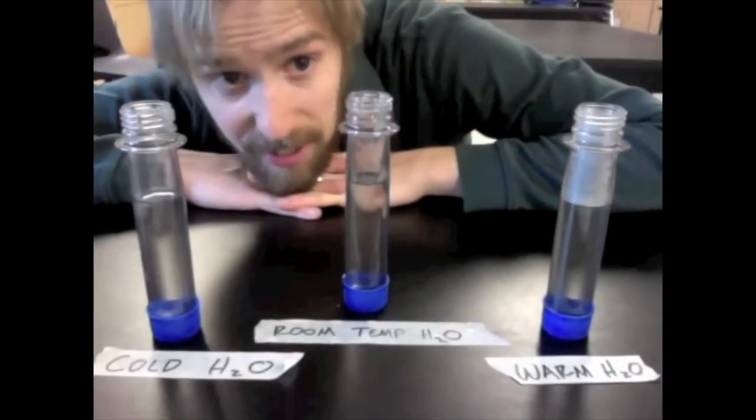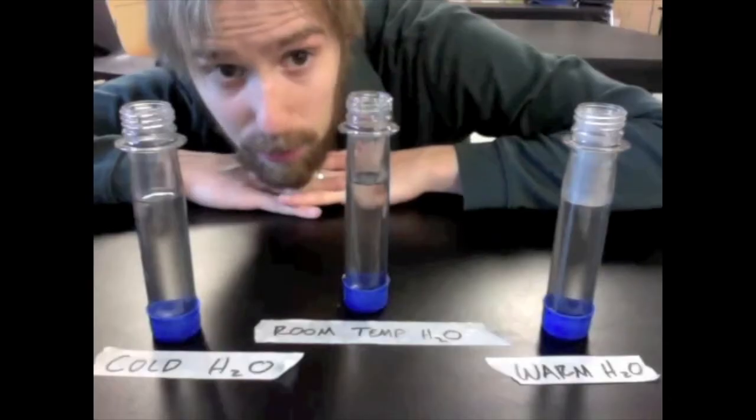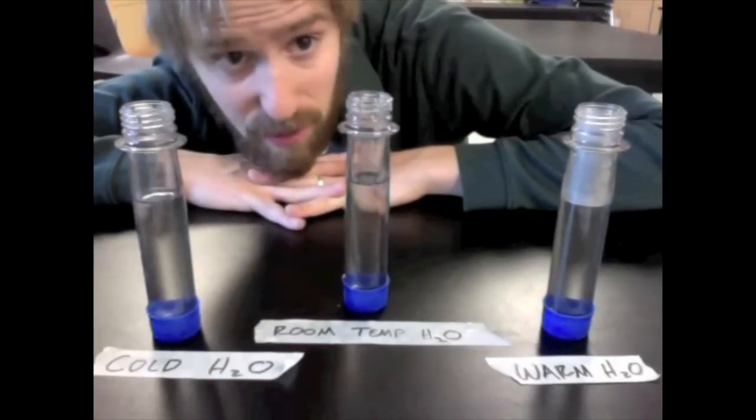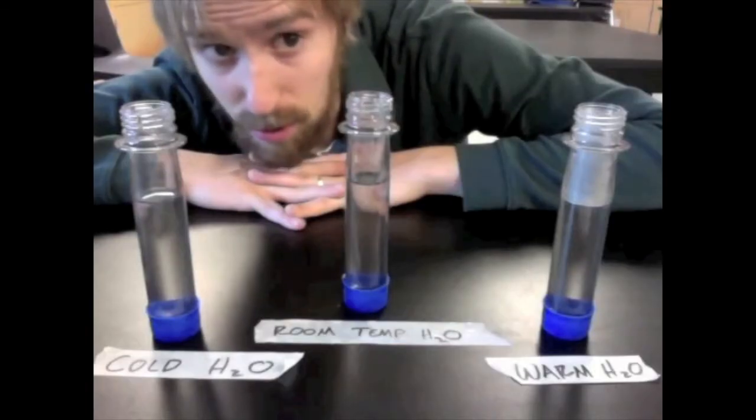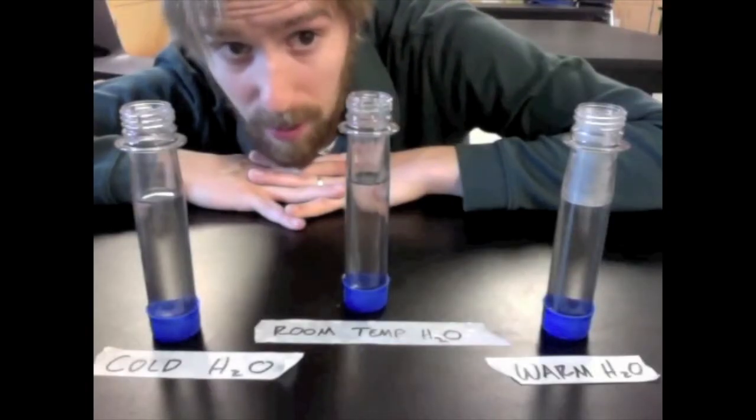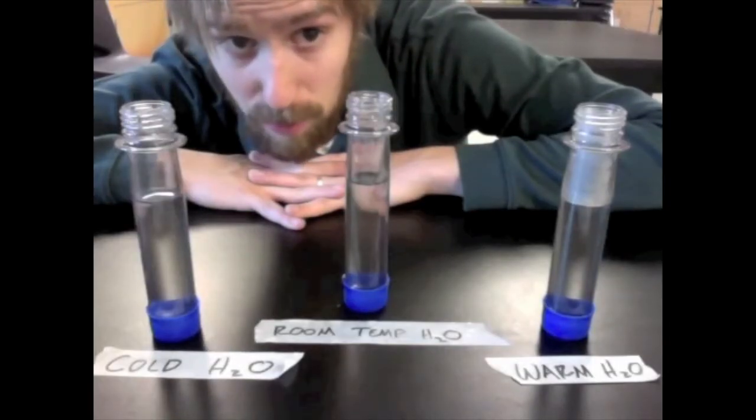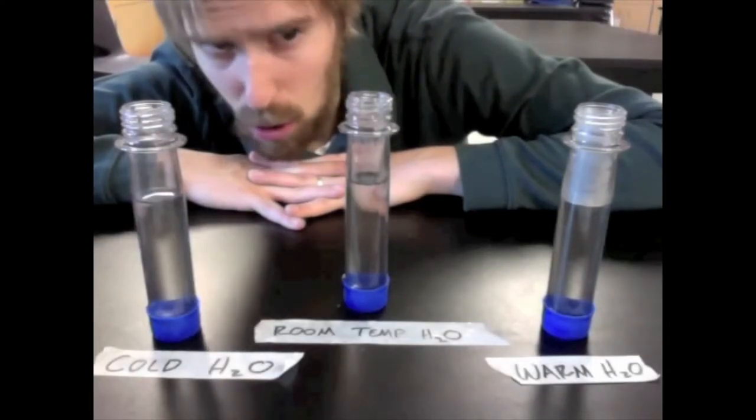All right, so we're going to do an experiment today to test the effect of temperature on rates of fermentation in regular, ordinary, everyday bread yeast. The same yeast that you could buy at the store. And remember, this particular process is the thing that makes bread light and fluffy and explains all of those beautiful little air spaces that make it so delicious.